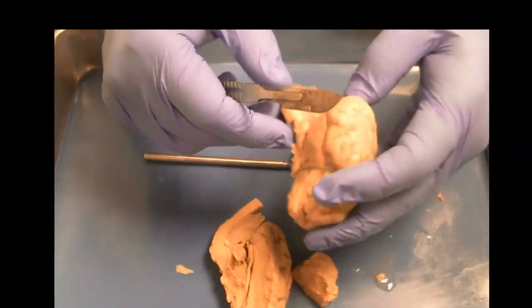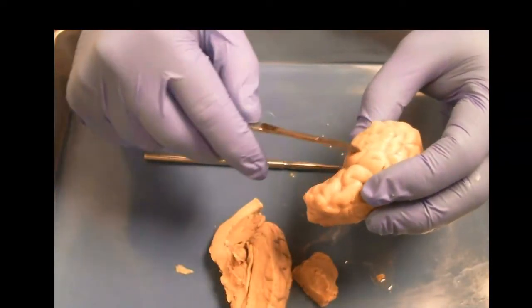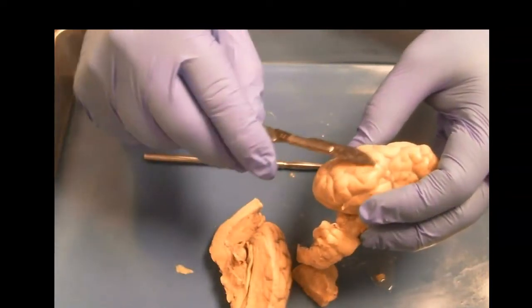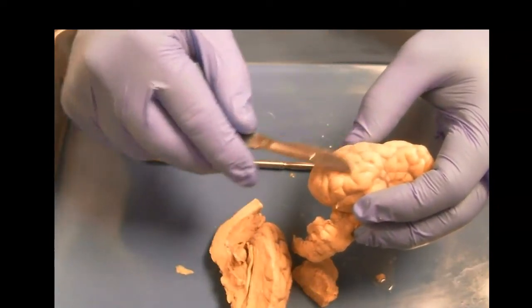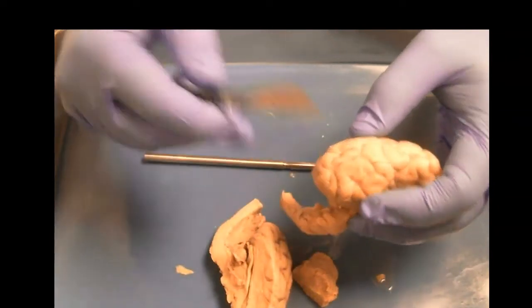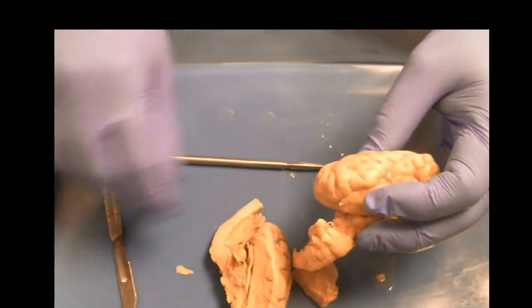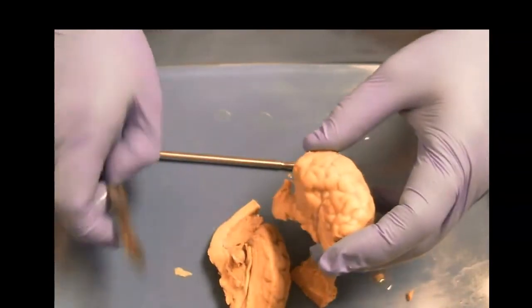But this is a little tough. In humans, the temporal lobe is huge by comparison. We've got a lot of our language processing there. The sheep's got, what, baa? So there's not a lot. However, it does have a pretty decent sized hippocampus.